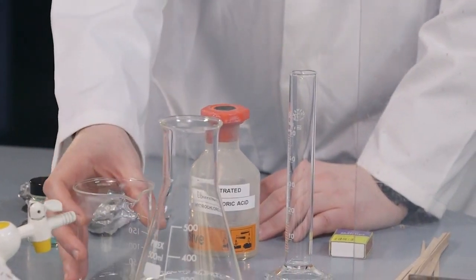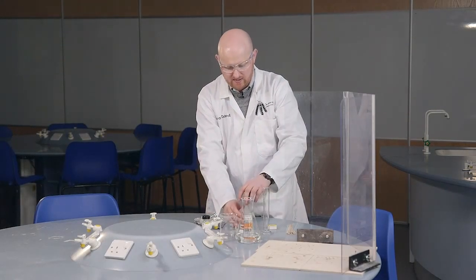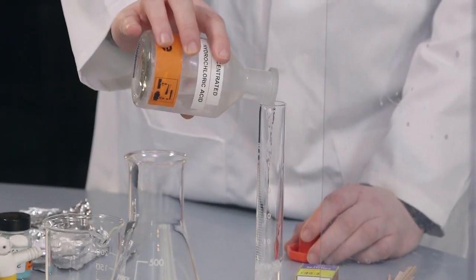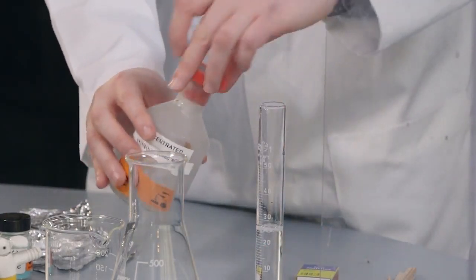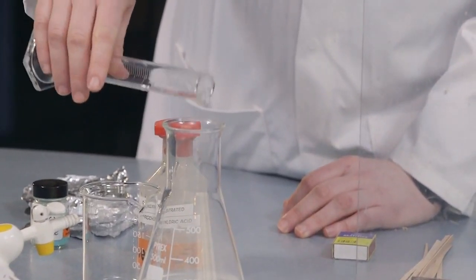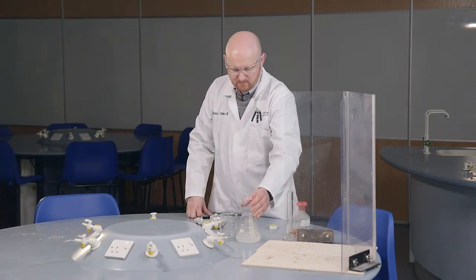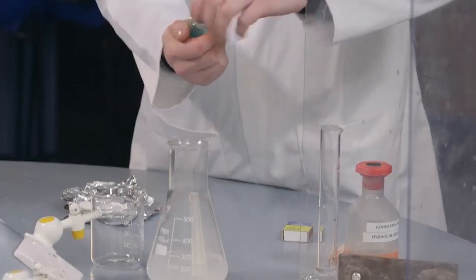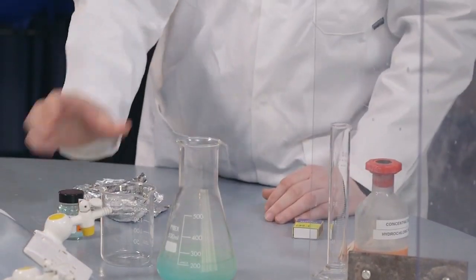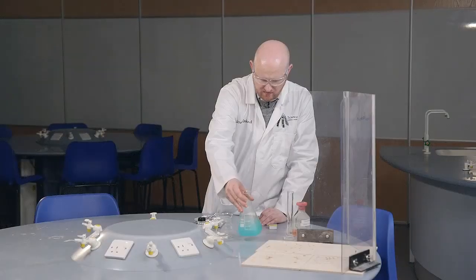like so. And then we're going to take our hydrochloric acid and add 20 mil of hydrochloric acid into our water. And again, remember, this is conc hydrochloric acid. And pour that in. Just remembering, of course, to always add our acid to our water. Then we add our copper 2 chloride, like so. Just give that a stir. So we're just giving it a swirl just to dissolve that copper 2 chloride.